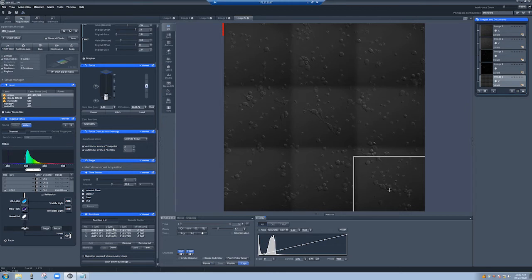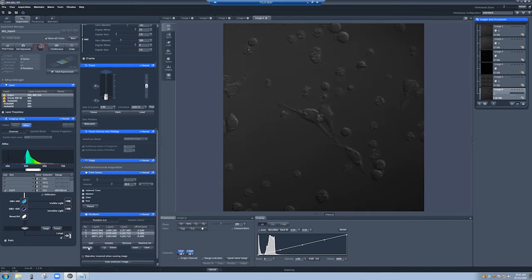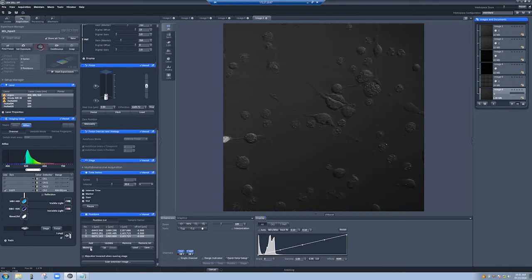Let's see how we move between the positions. If I go to live, you can see this particular one. If it's out of focus, we can refocus by clicking here. Now if we want to update the position's Z coordinate, we can click here on update. We can then go to the next one and make sure it looks good. If I click on it and then say move to, there we go. This one looked good because it was the one in the middle where we were imaging before. And then we can go to this final one. That one actually doesn't look bad, so we can leave those alone. So now we have these three positions. We have the autofocus on.